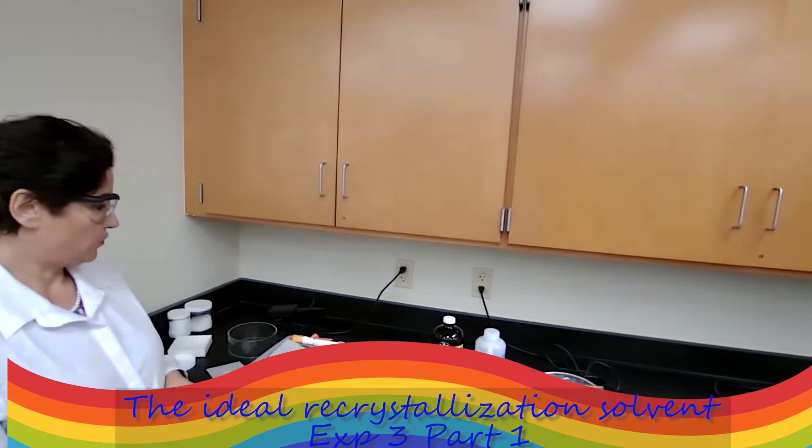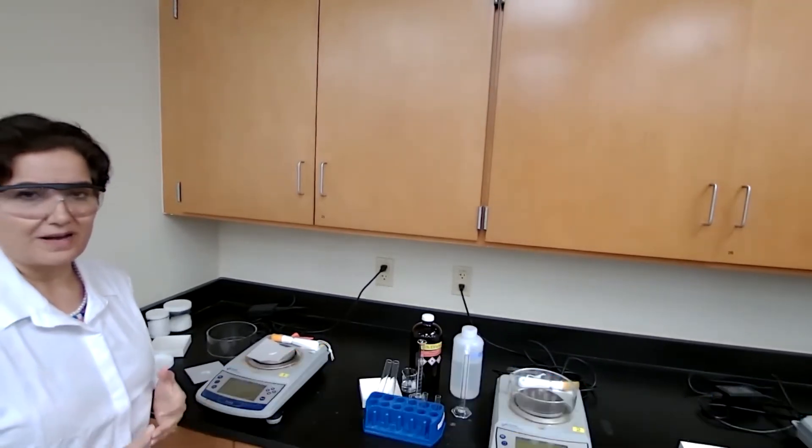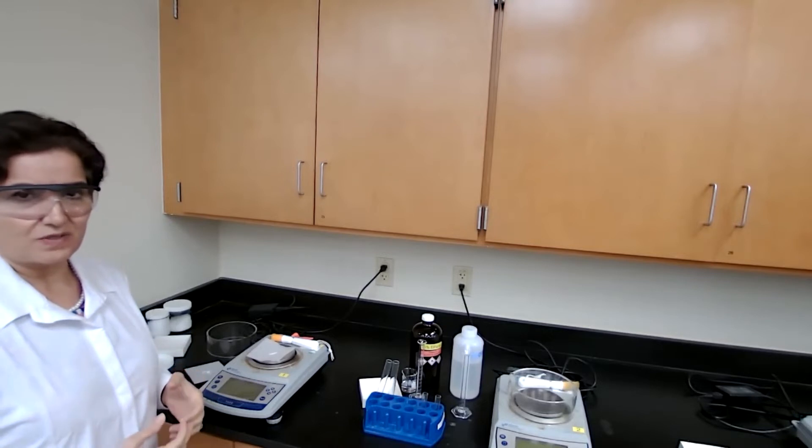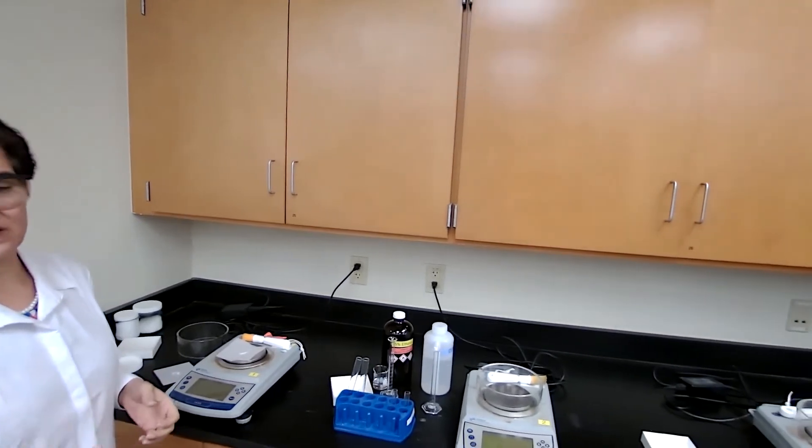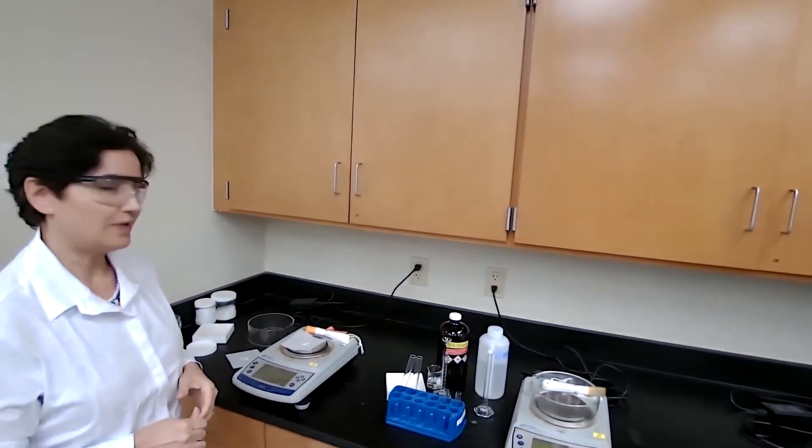For experiment 3, we are going to perform recrystallization. I hope that at this point you have watched the pre-lab discussion which covers the theory of recrystallization. Everything about recrystallization is covered in the pre-lab discussion.